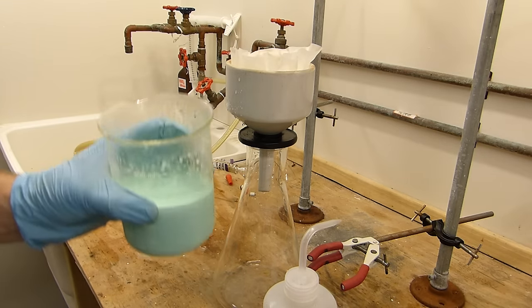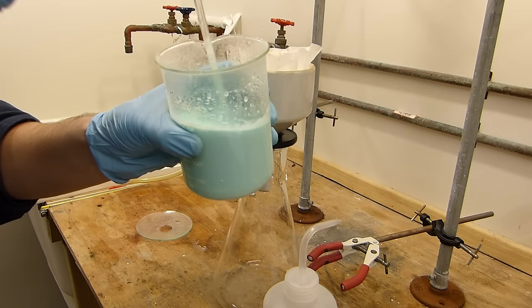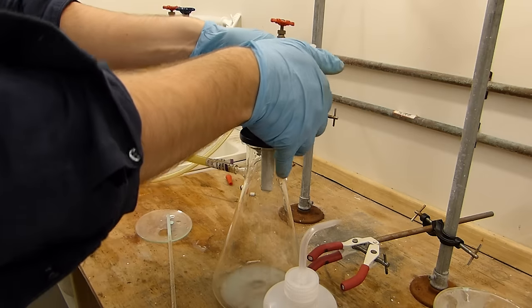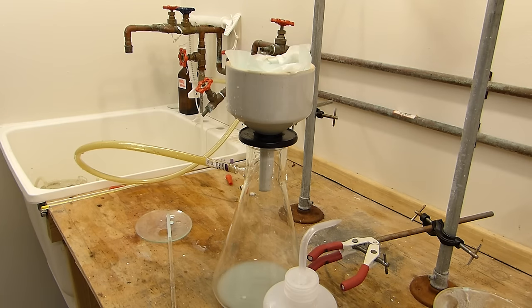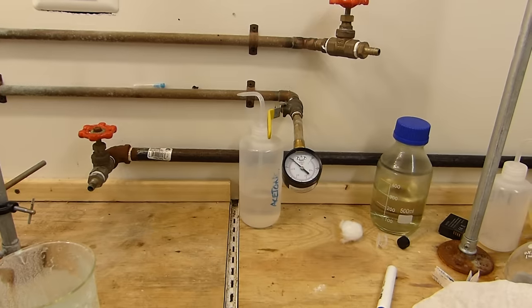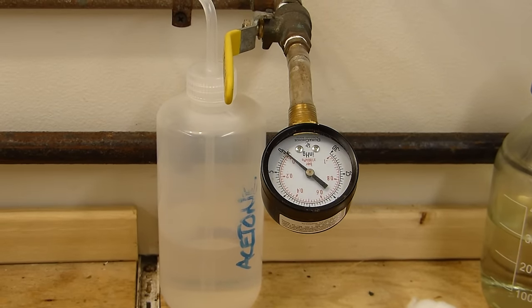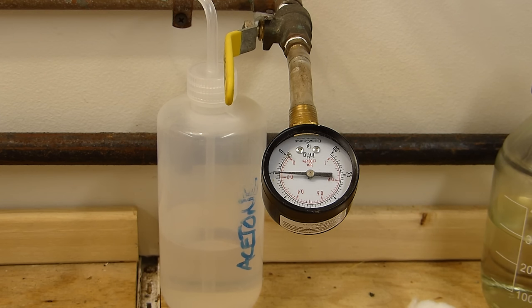All right now to begin filtering. I'm first going to agitate this solution by stirring it to get as much in suspension as possible before I add it to the filter. Very slow vacuum filtration. Oops I just lost vacuum pressure. You can see there I've got a gauge. So here I'll press down on the funnel. It's helpful to have that gauge so you know when you're getting a good seal so I can wiggle it around until, oh there you go see I just made a seal. It's in negative inches of mercury which is a stupid measurement in my opinion but that's fine. It'll sort of stick to the flask at about minus five inches of mercury.